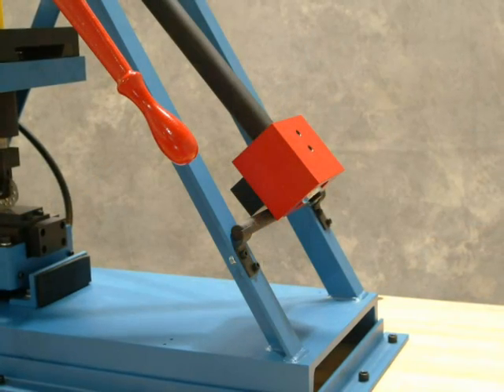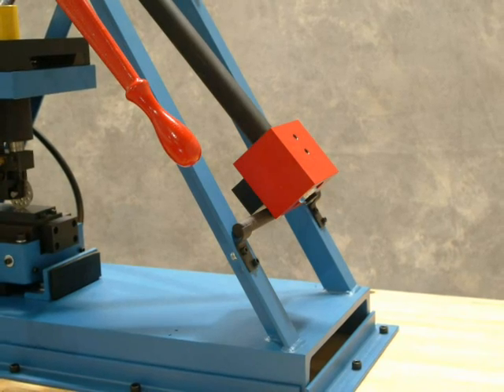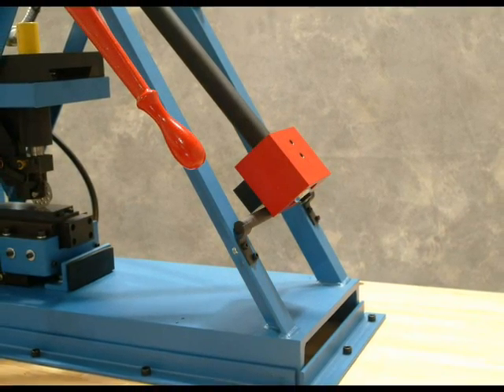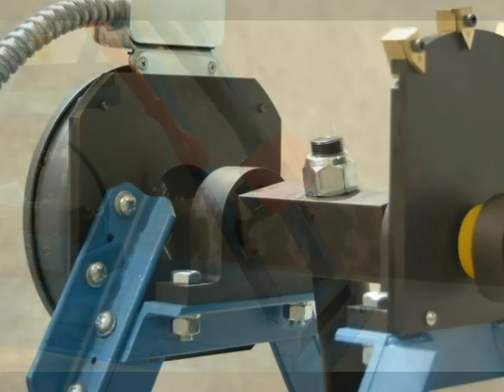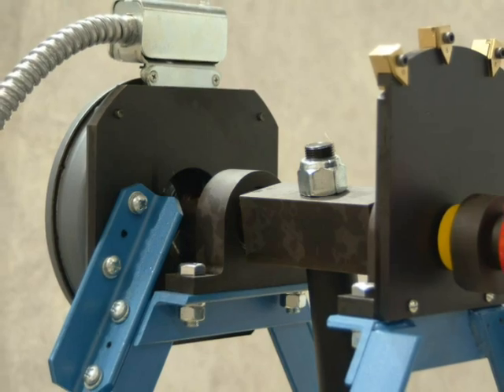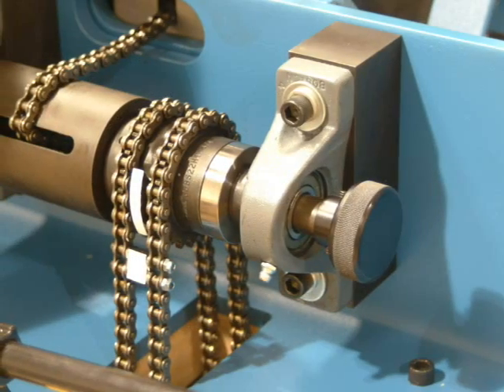For high speed measurements, the sliding anvil is moved by striking it with the swinging pendulum. The speed of the moving anvil is controlled by adjusting the pendulum drop height. An electric brake holds the pendulum arm in position until the apparatus is actuated.